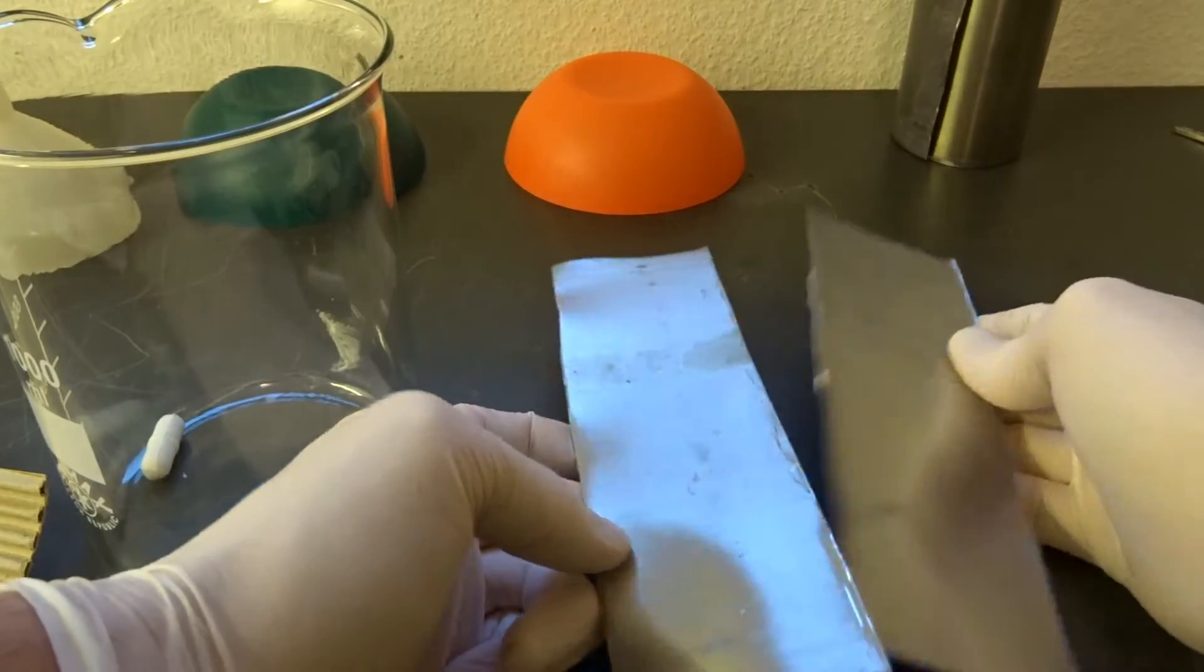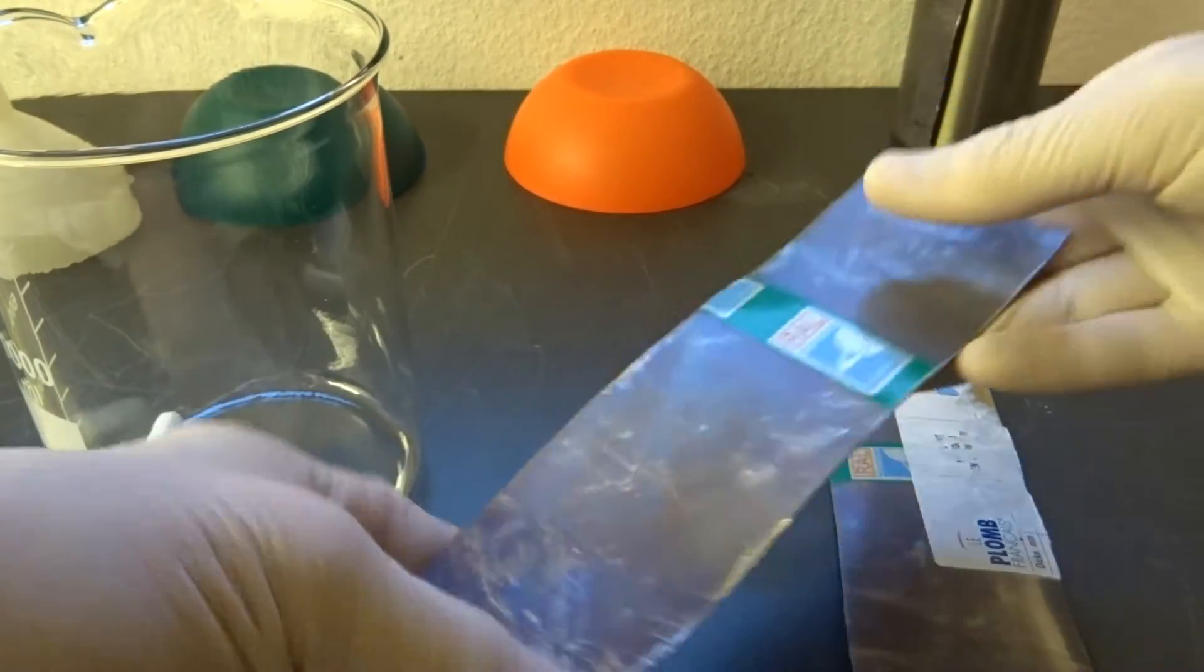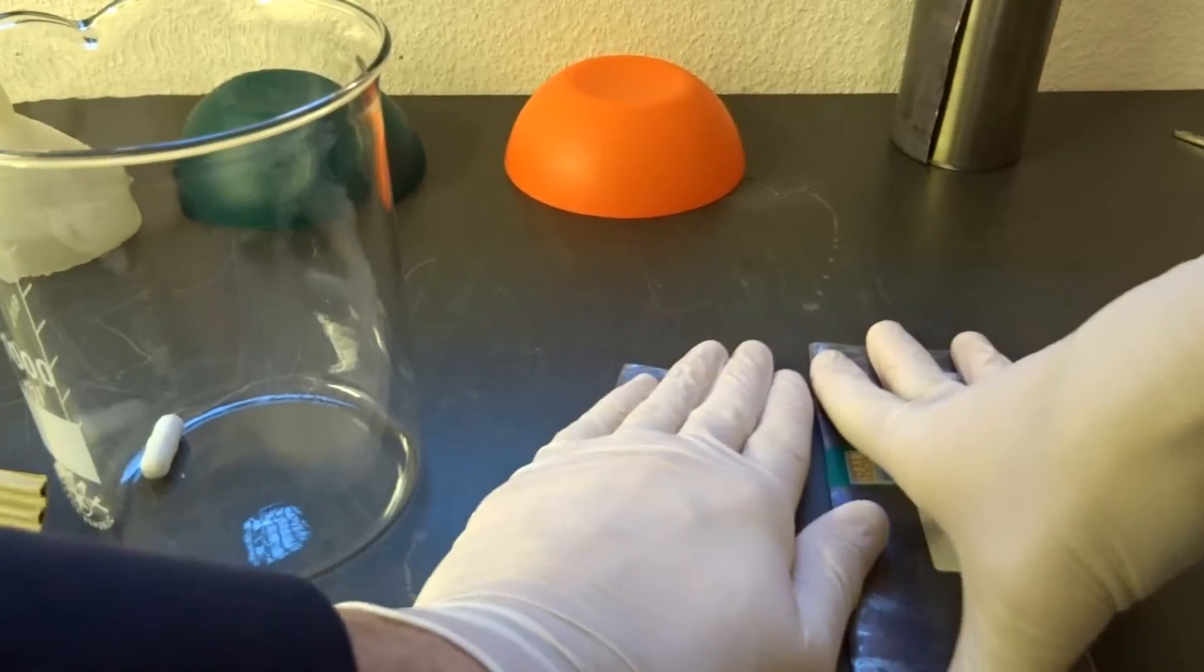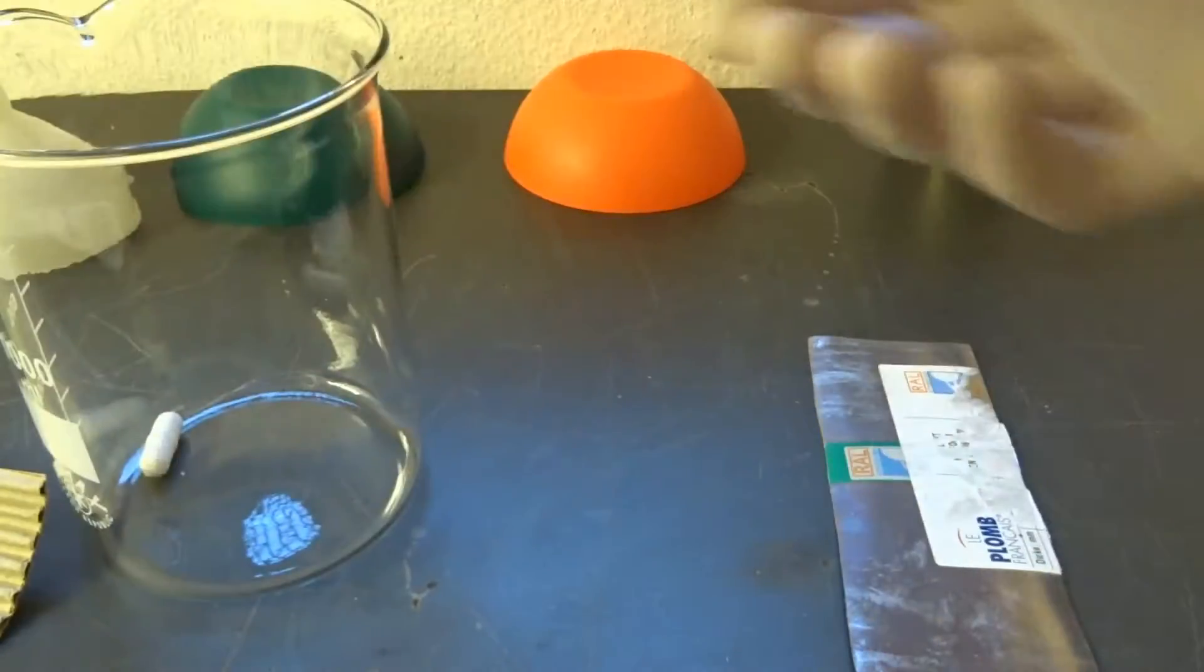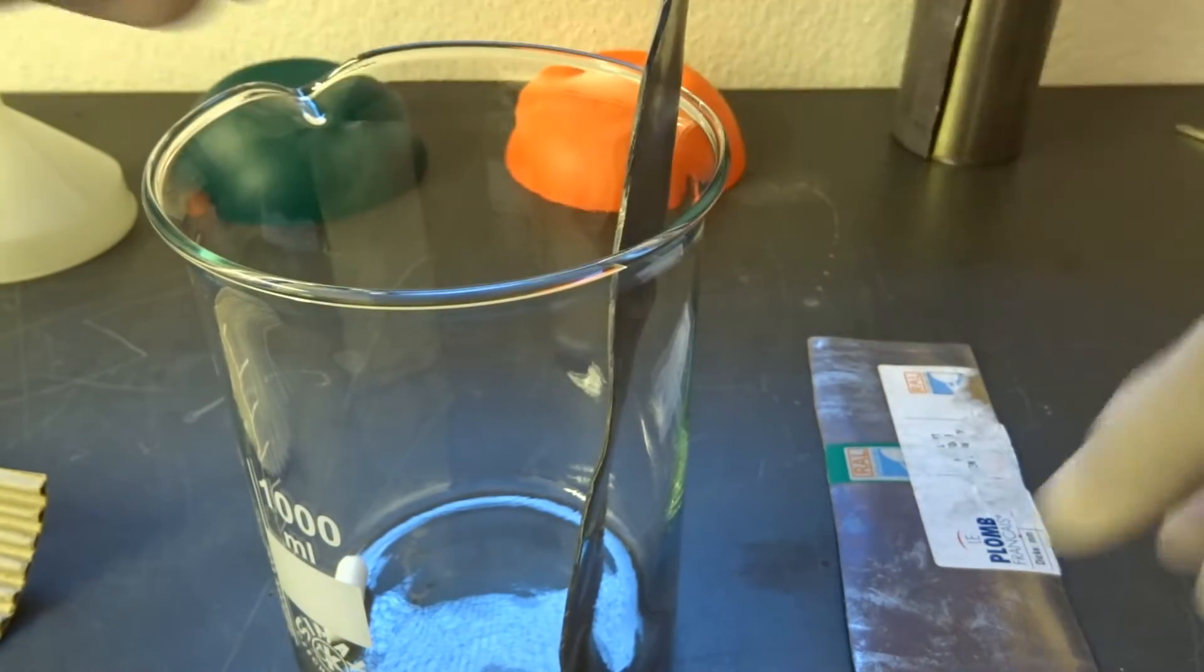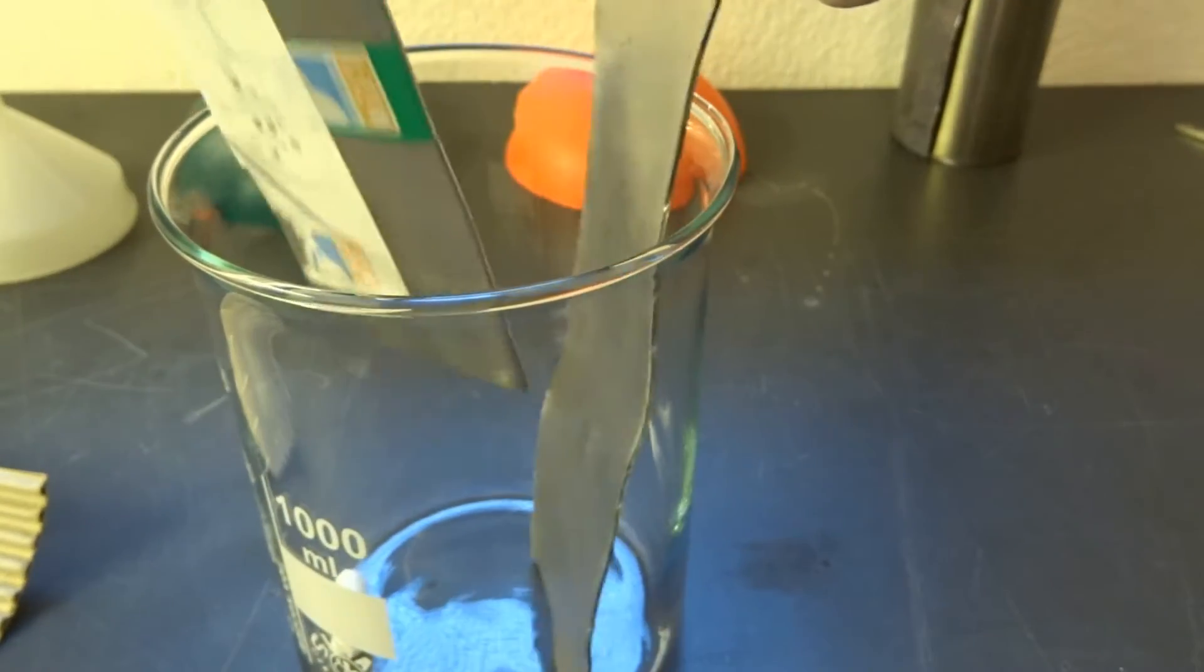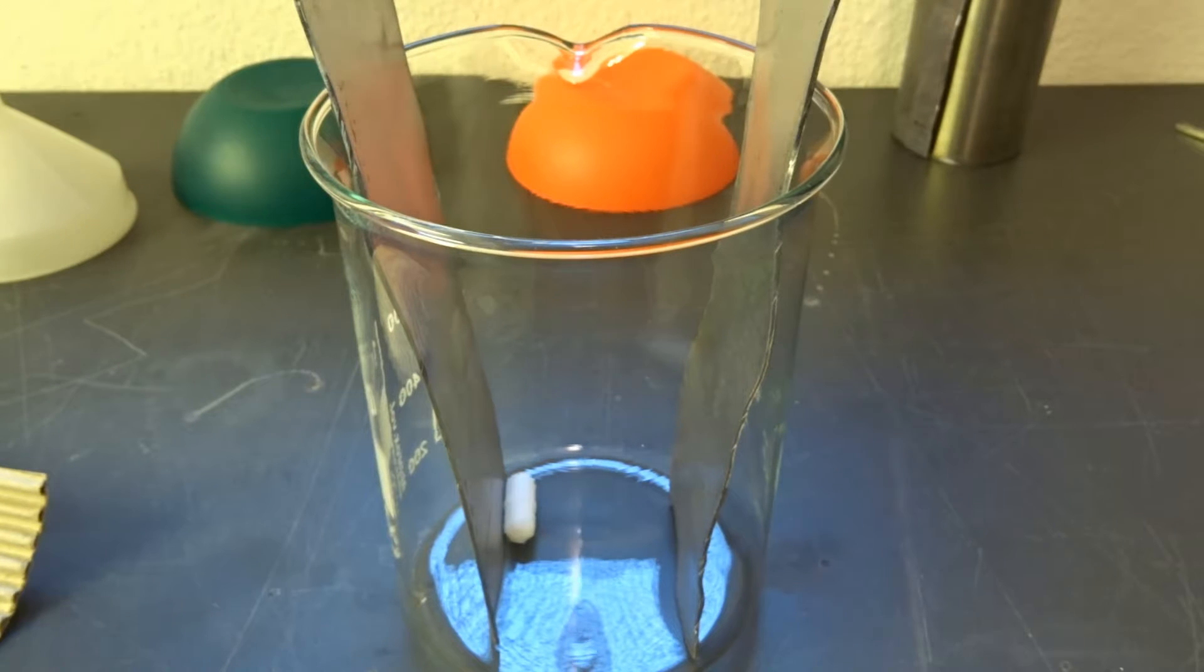Here I've got two beautiful electrodes. Just need to get off this covering and make them even. They already have the perfect size for this large beaker. My plan is to insert them like this, then start electrolyzing the whole mixture.